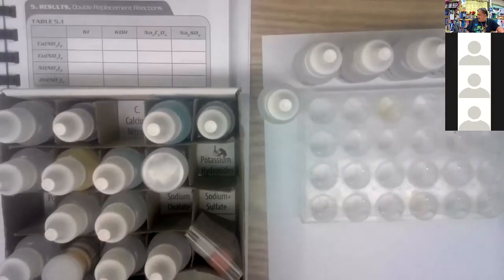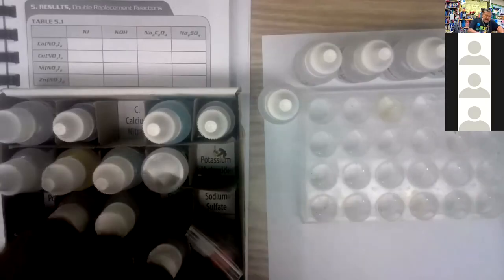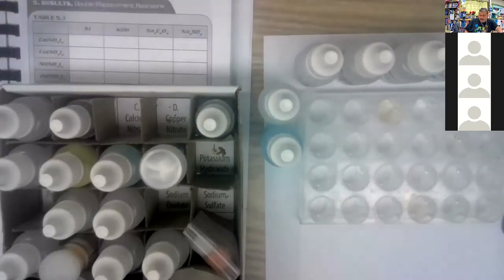So looking at the inside cover of my box, copper nitrate is first row, fourth over. So there's the second one. The third one, we'll focus that, is nickel nitrate. Now the nickel nitrate, where's that? Nickel nitrate is in the second row, third over. Right there. And then the fourth one is, what is it?